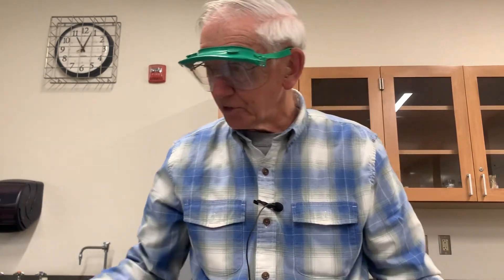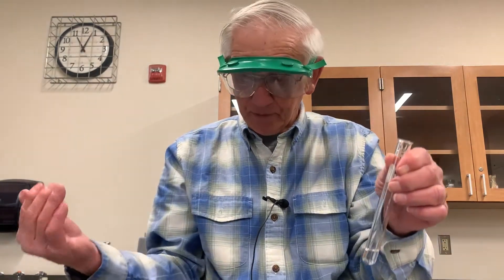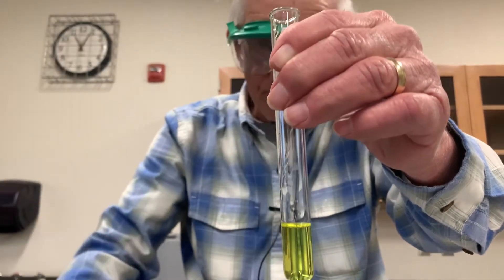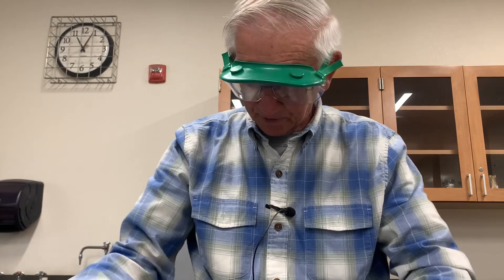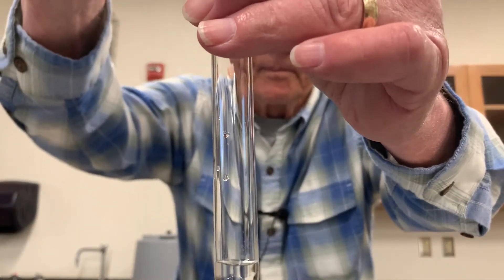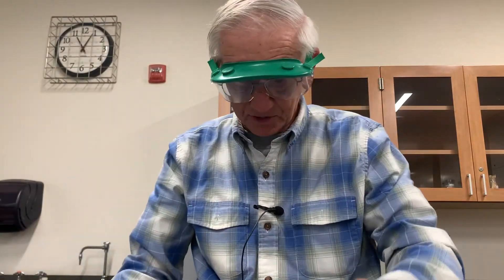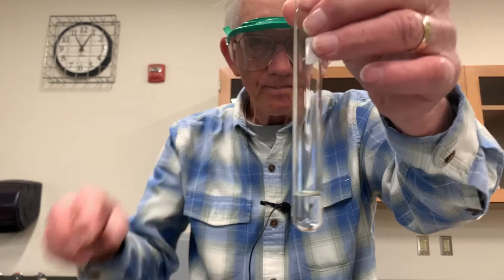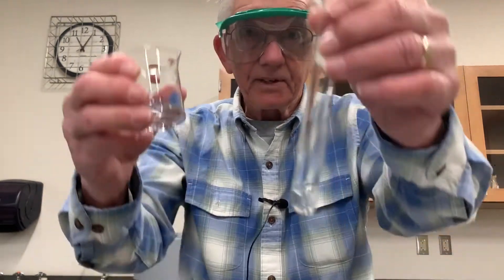Now let's try unknown number seven, which I've already prepped here. Unknown number seven is one of the four cations — it could be the same one or a different one. Let's see what happens with number seven and chromate. How about number seven and oxalate? Number seven and sulfate. And finally, number seven and hydroxide.